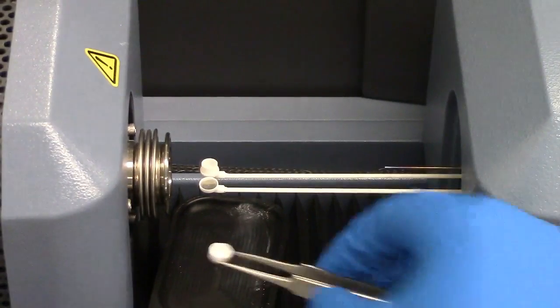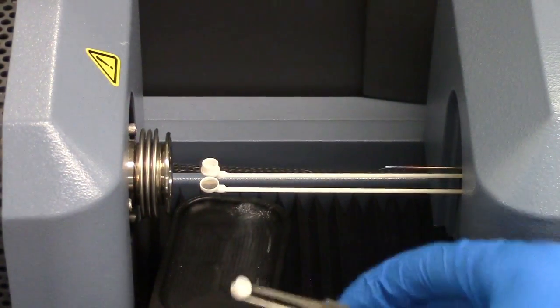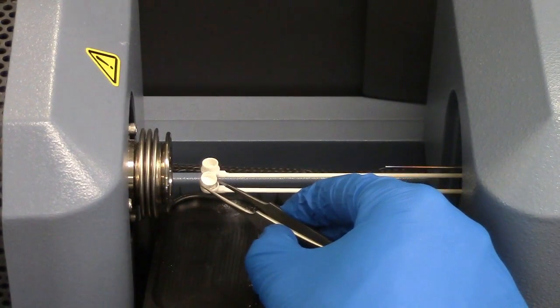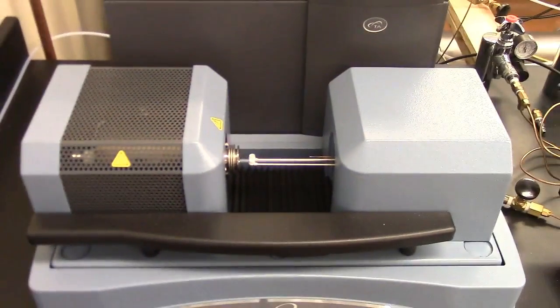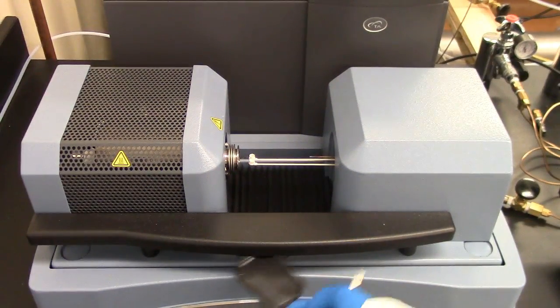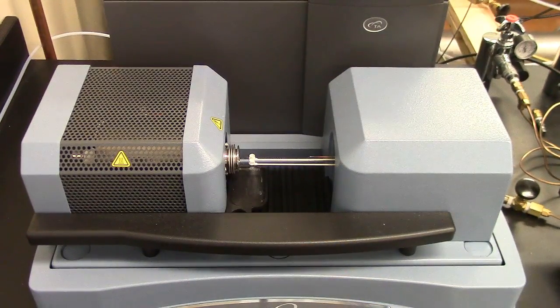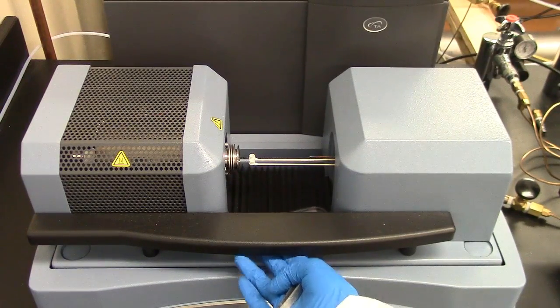There's a small little pan we can push out to make sure that we don't drop anything. We're going to put this to the closest one to us. In case you didn't see where that pan came from, it's right here. So whenever you're loading a sample, have that pan out there to make sure that you don't drop the sample.